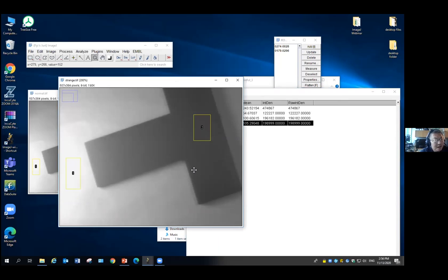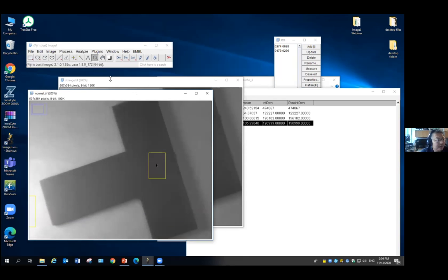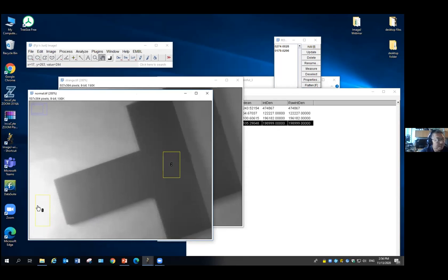But when you actually check the intensity value and move in here, you can check the intensity here. You will see it has a huge variation. Here it is 154, then it's 58, and here we have 153, and sometimes it's only 55. Then moving to the normal one, that is more consistent. Intensity is about 63, 60-something, and in this region it is close to 240.